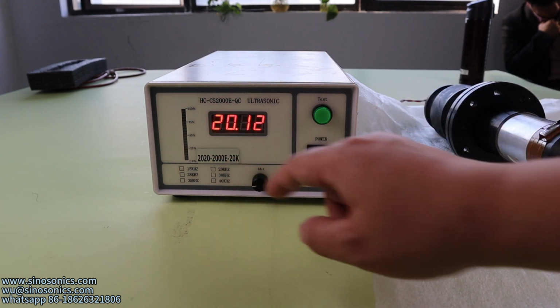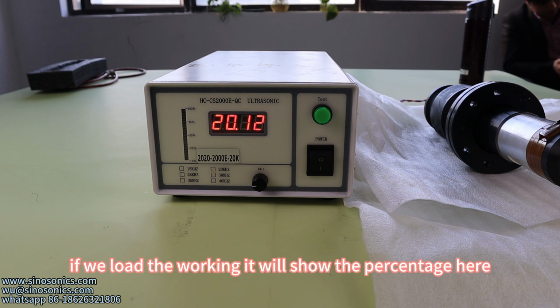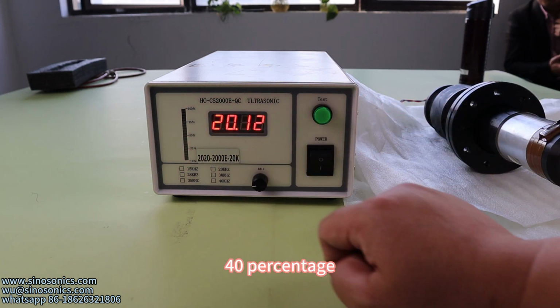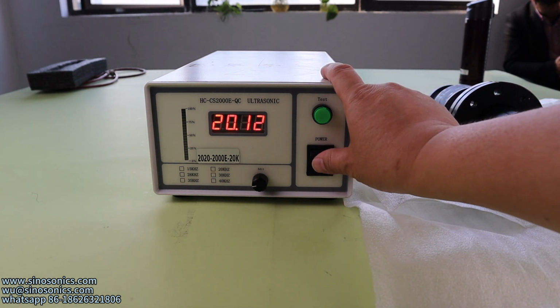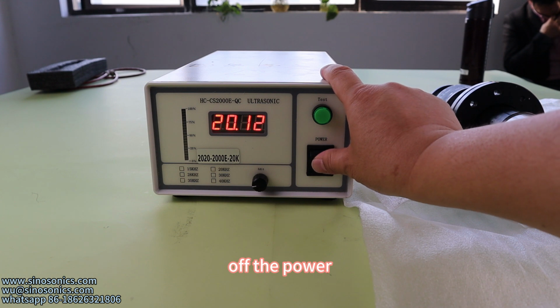This bar shows nothing because it's no load working. If we load the working, it will show the percentage here, 40%. Now turn off the power.